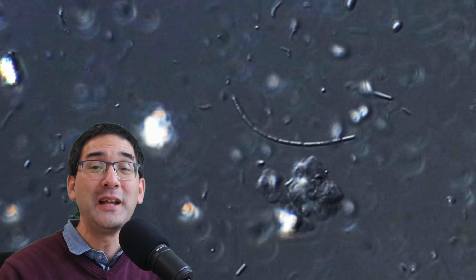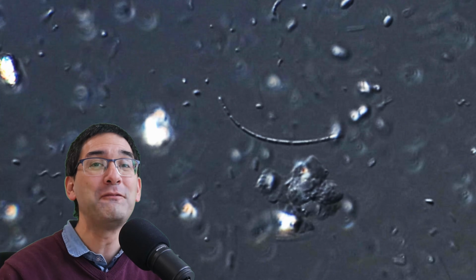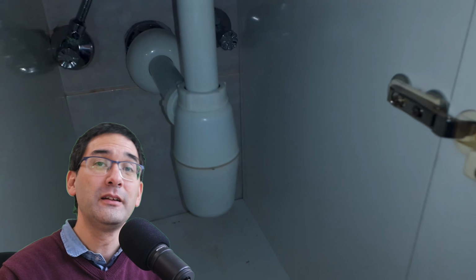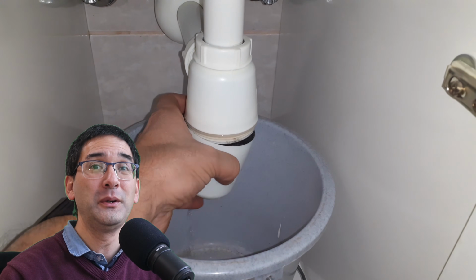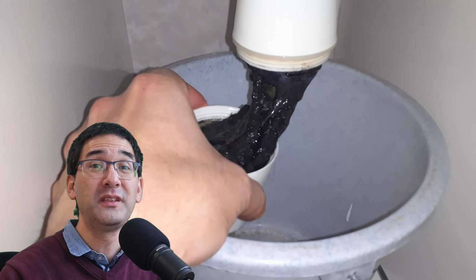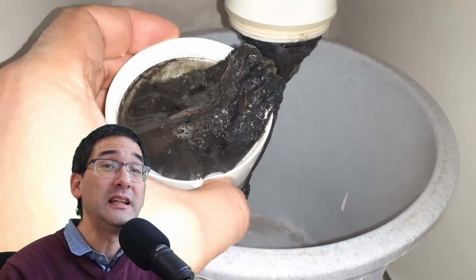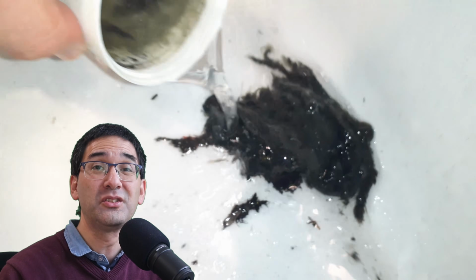So, and what I'm going to do now is I'm going to show you now the mystery object, and I'm also going to show you now where I found the specimen. And yes, it is a pretty disgusting place. It is the drain of my bath in my bathroom, and it got clogged, and when I removed it, I could see that it was all filled with decomposing material, probably hair, a lot of hair, and I have no idea what else is there. Very slimy. It didn't smell really like anything, probably the decomposition process was just starting to happen.